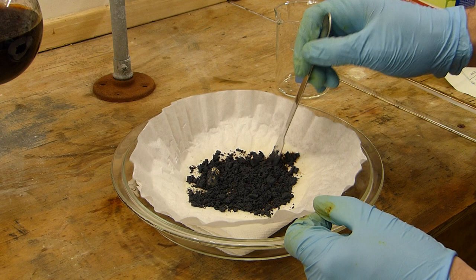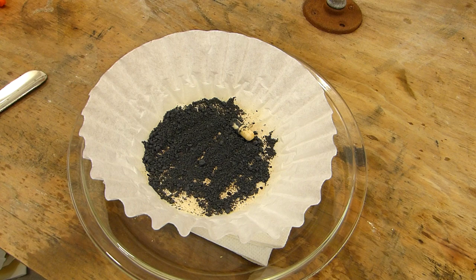So I'm just going to do my best to spread the chunks out as much as possible. And then we'll come back in a few minutes once most of the moisture has been wicked away by the paper towel here. And then I can go ahead and re-spread that.